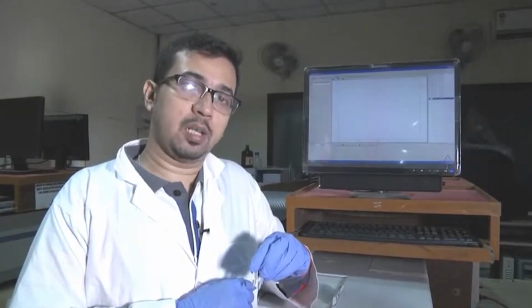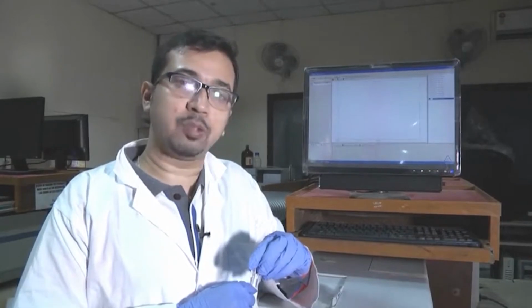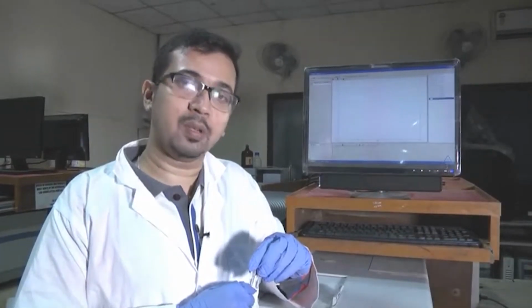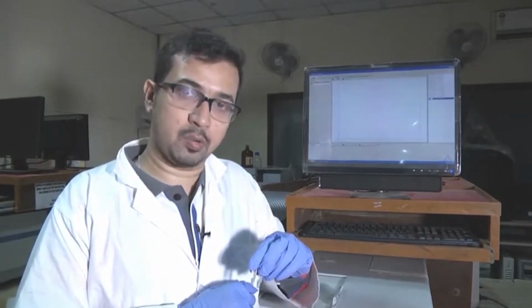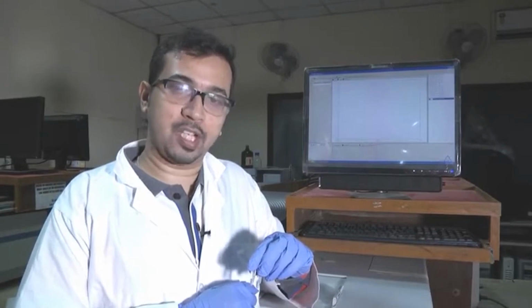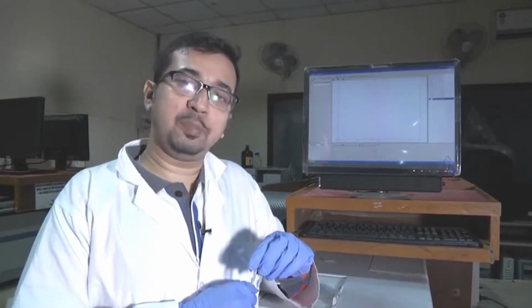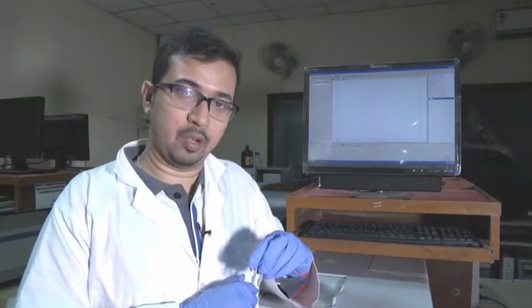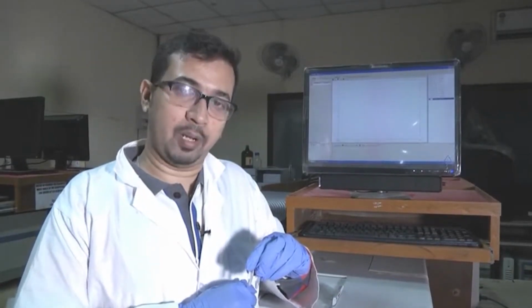We have just seen the effect of urea on HSA denaturation, the change in absorbance upon adding urea solution. Next, we are going to study the effect of temperature on protein denaturation. For this, we have taken a few samples of HSA having a fixed concentration, and we have suspended these samples in Eppendorf tubes, as you can see here, in a water bath at different temperatures.